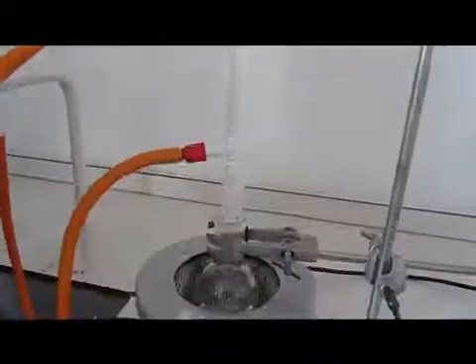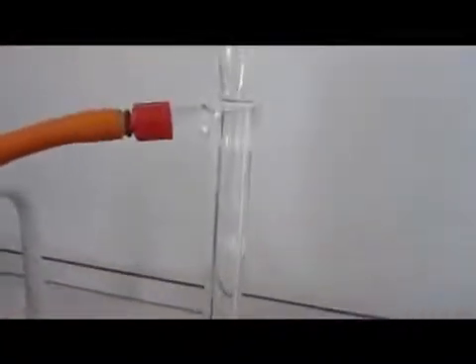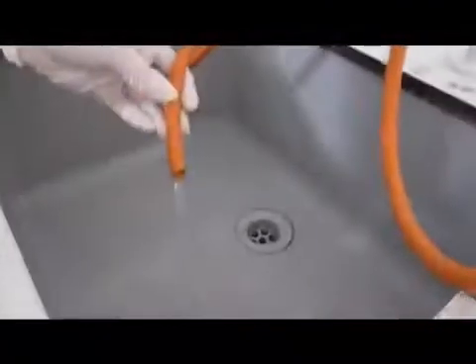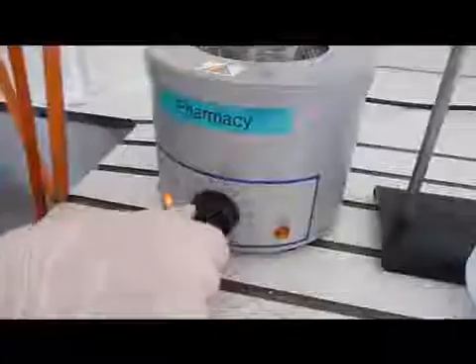Slowly turn on the water so that a gentle stream of water is seen flowing from the top hose into the sink. Turn the heating mantle on.